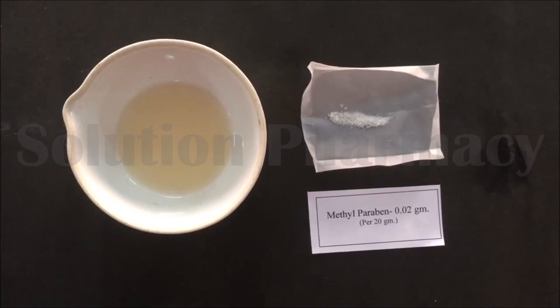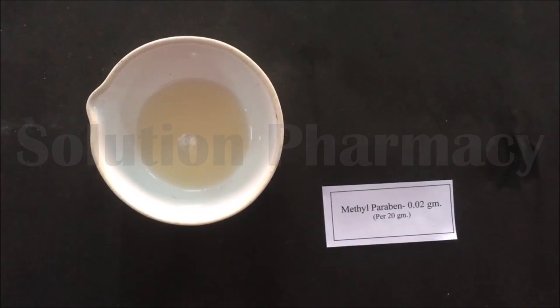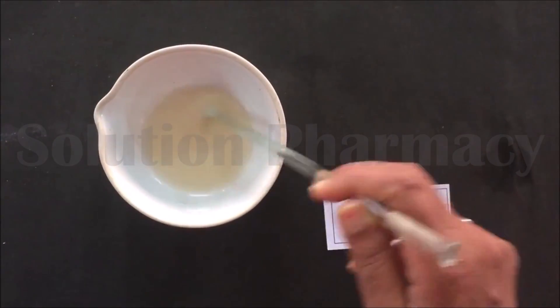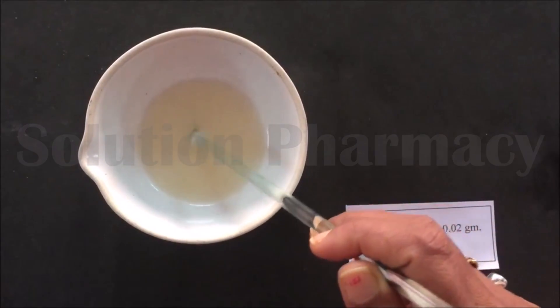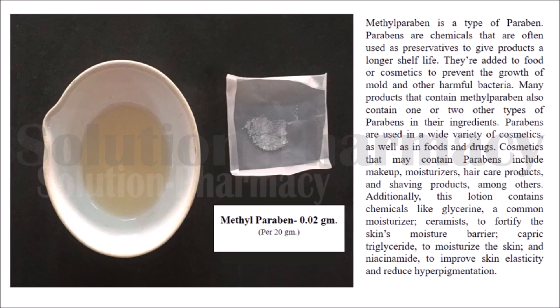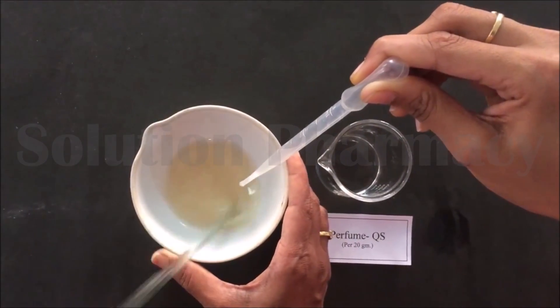The next step is to add methylparaben. We have already weighed 0.02 grams of methylparaben — transfer it into the china dish and mix it with a glass rod. Continuously stir until the particles of methylparaben are completely dissolved. Here methylparaben acts as a preservative — it preserves and protects our preparation from bacteria and prevents the growth of bacteria in our preparation.